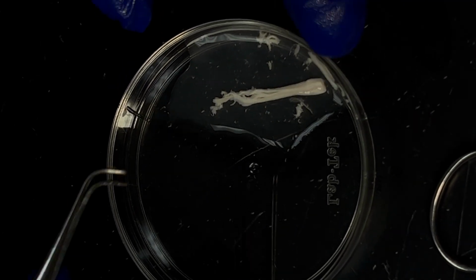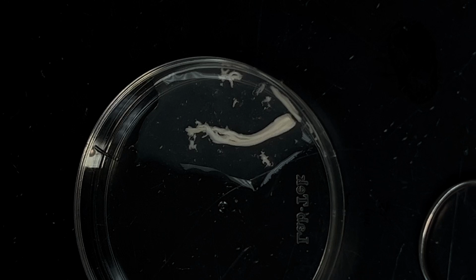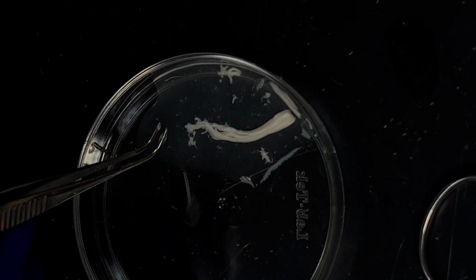So for Wednesday, all we need is this whole thing. Cool, so it's easy, you just lift it out. And Ariana, do you want to practice the next one?